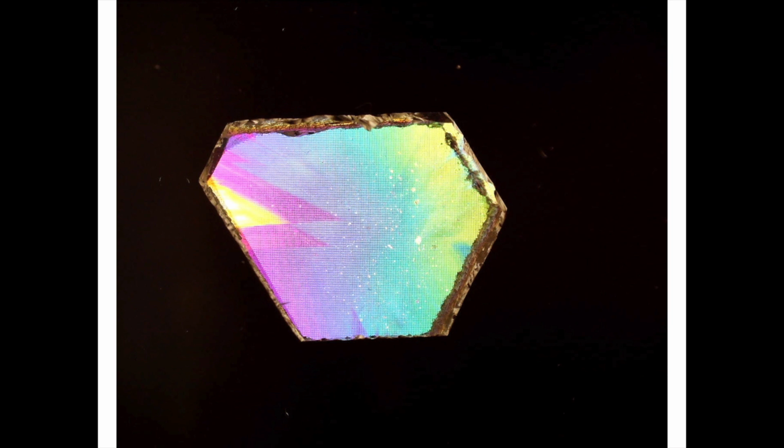Also, you should note that if viewing quartz in thin section, the thickness of the section is insufficient to show off this optical activity. So you're only really going to see this associated with quartz in thicker sections, and it's a great way to identify something as quartz. For this quartz slice in particular as well, I didn't quite get it perfectly looking down the c-crystallographic axis, and that's actually why we have the tie-dye color effect. If I had gotten it perfectly cut, you'd just see one solid color as we looked across the crystal.